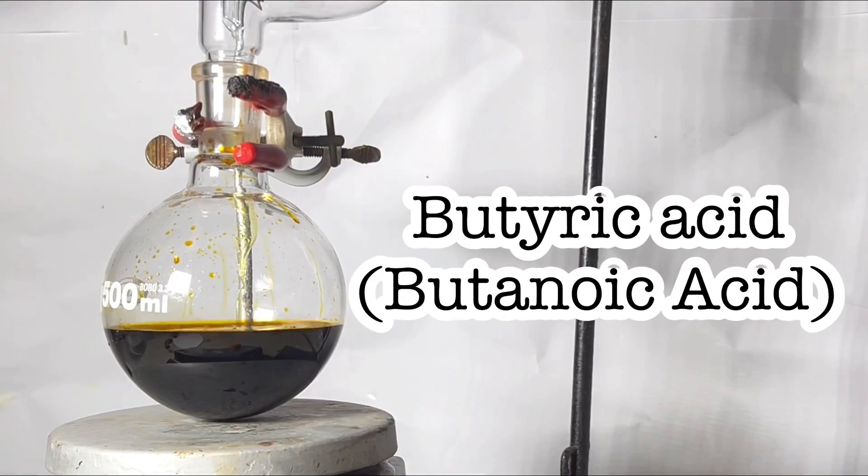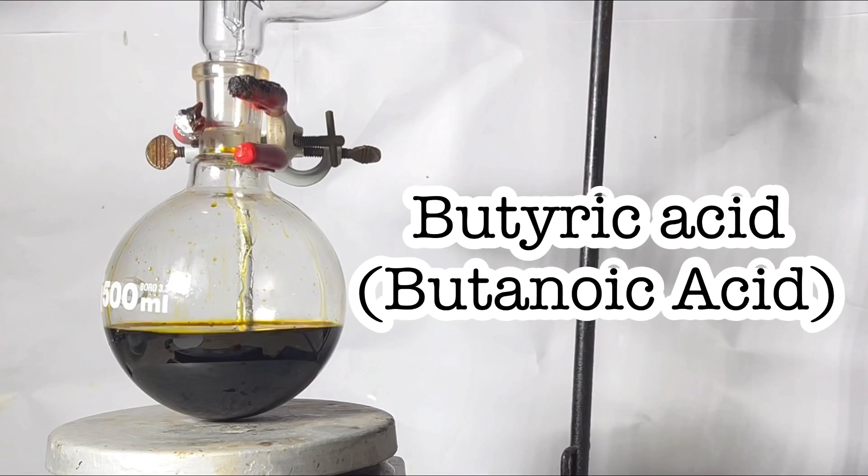Hello friends, in this video we will be synthesizing butyric acid or butanoic acid from 1-butanol using chromic acid as the oxidizing agent.